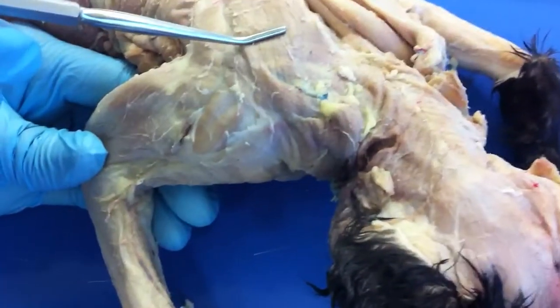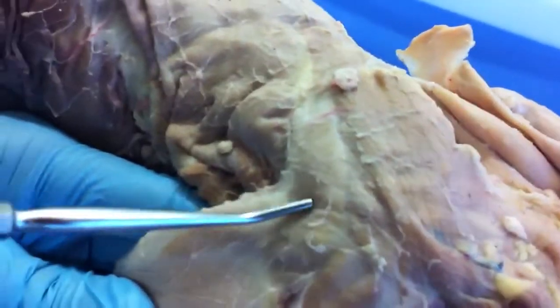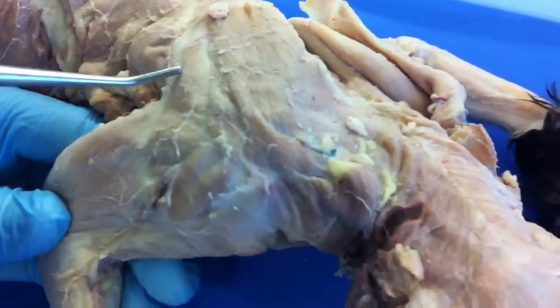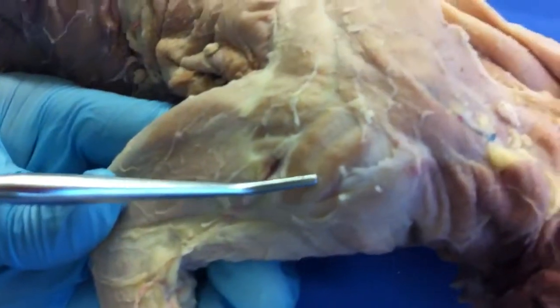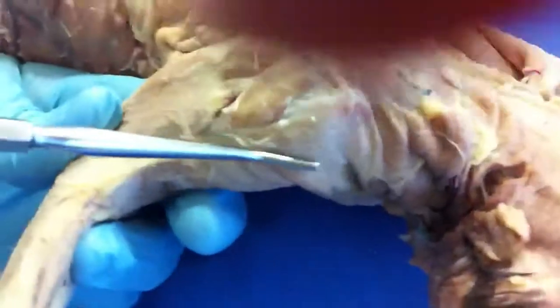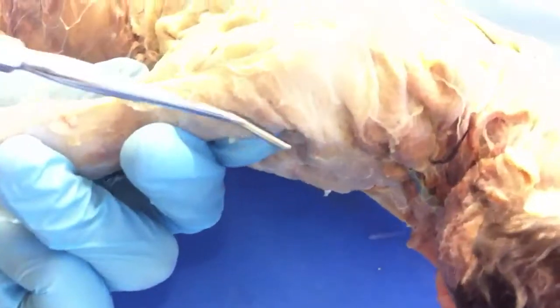And then we have the spinodeltoid, which is kind of a landmark feature — it's that triangle shape. Then we have the acromiodeltoid right there. And then running down the front is the clavobrachialis.